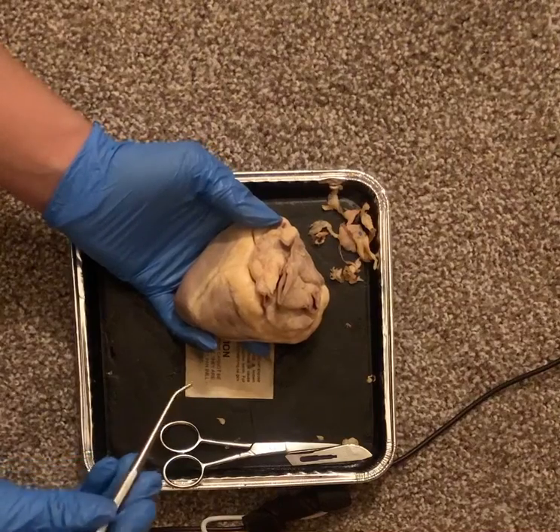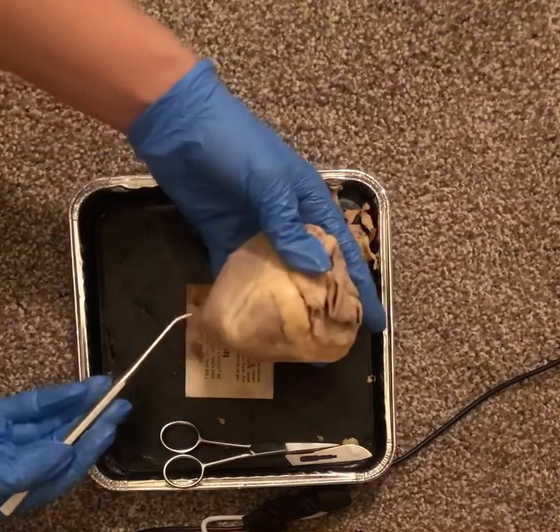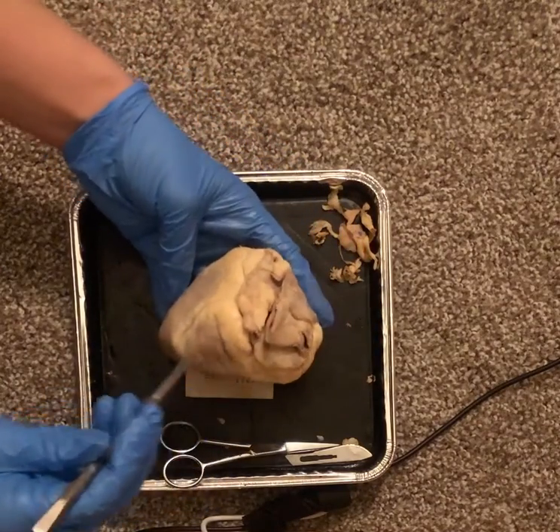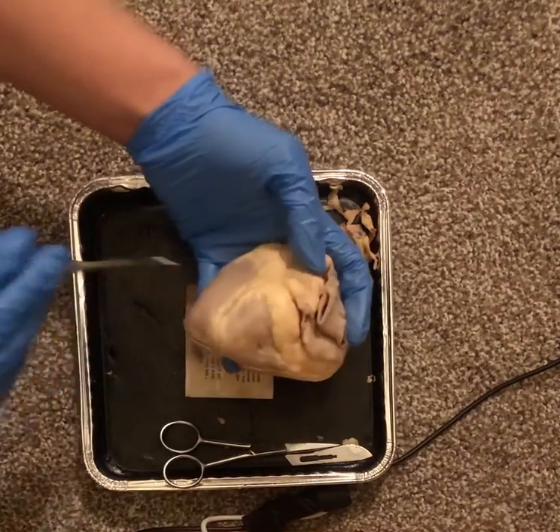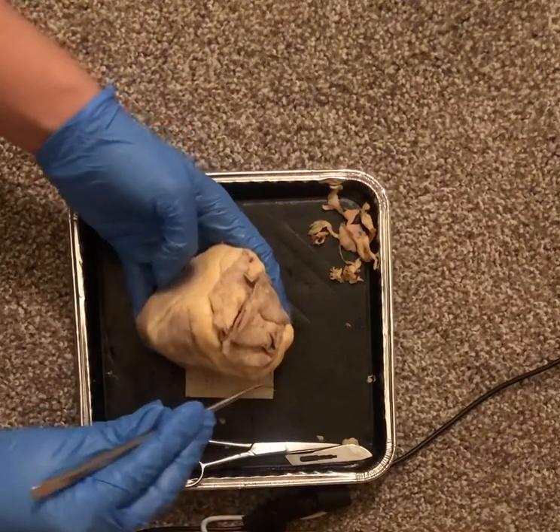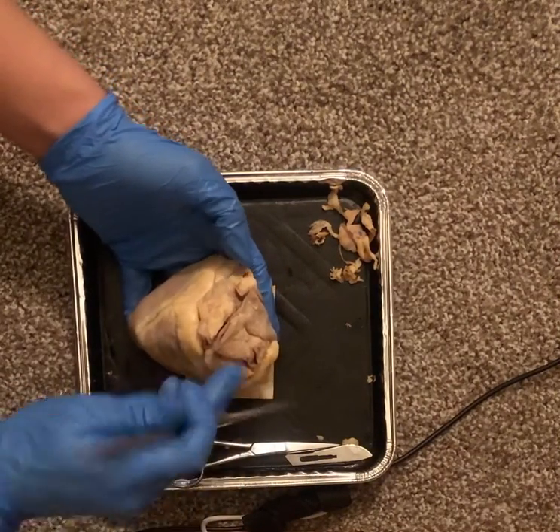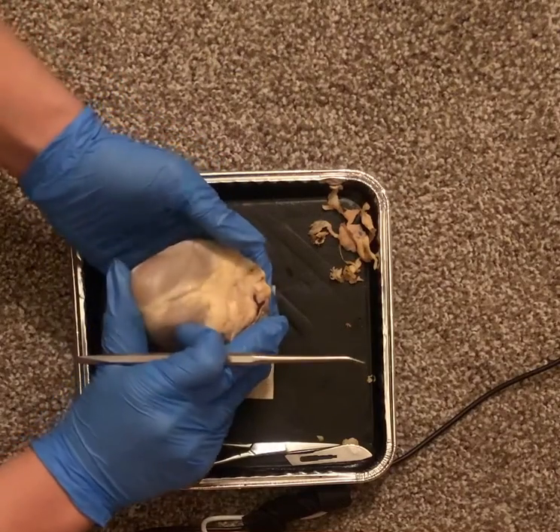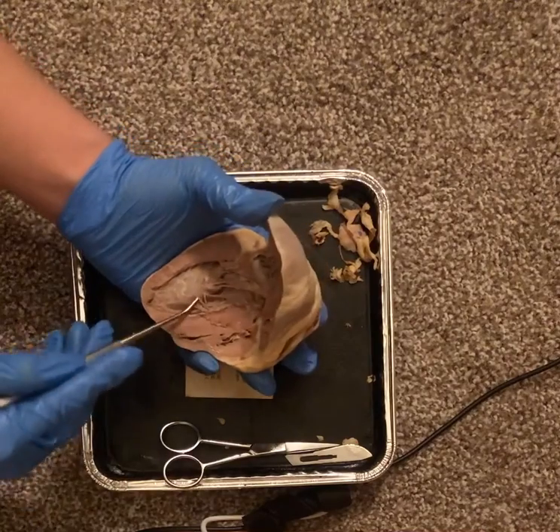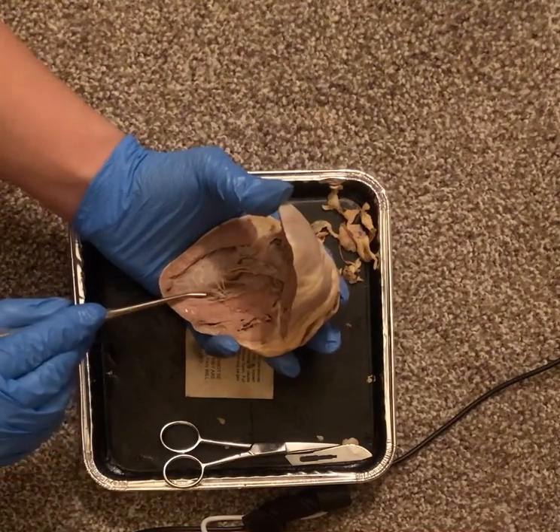From there, we have the inferior vena cava that would be right here, returning blood from the body to the right atrium, so it would be right here. Then, digging further in, we have the interventricular septum, which is the wall of muscle between the right and left ventricle. So it's going to be this wall of muscle right here.